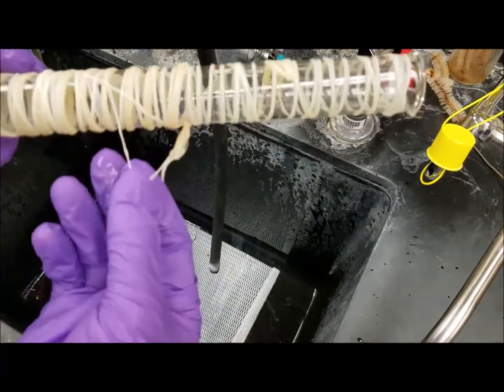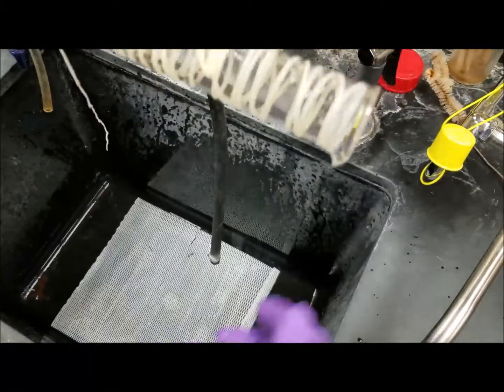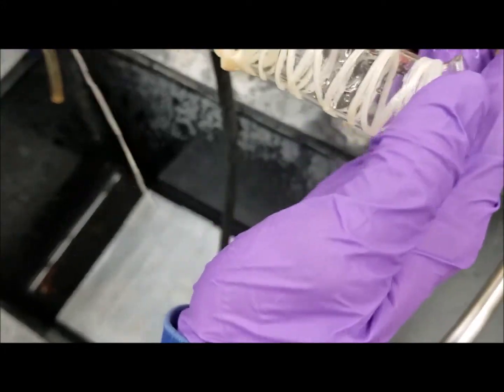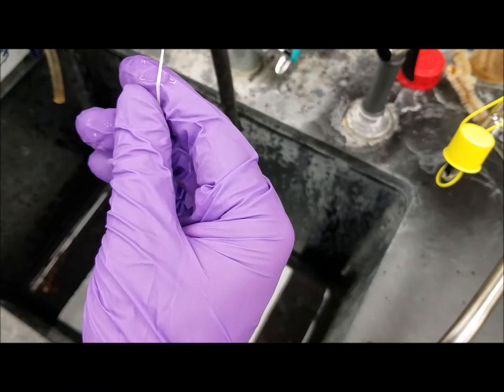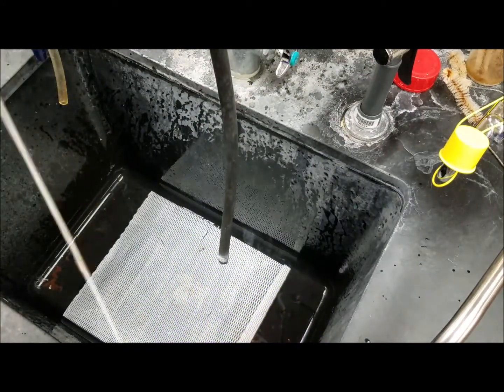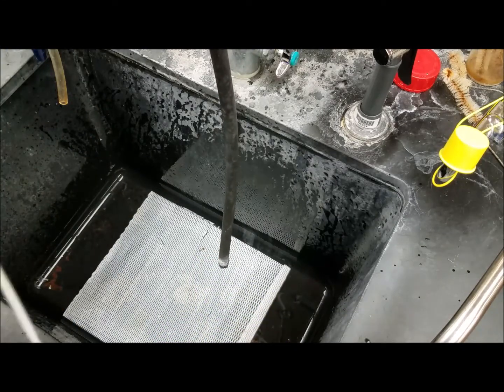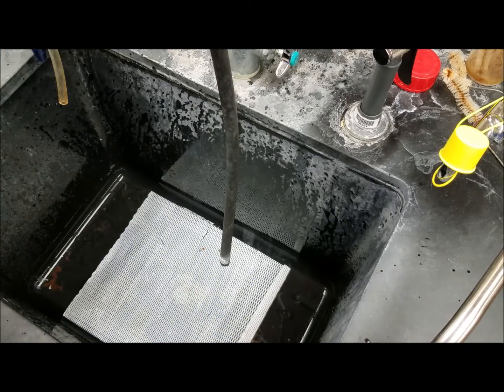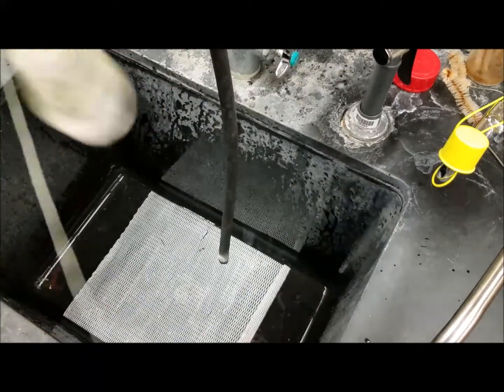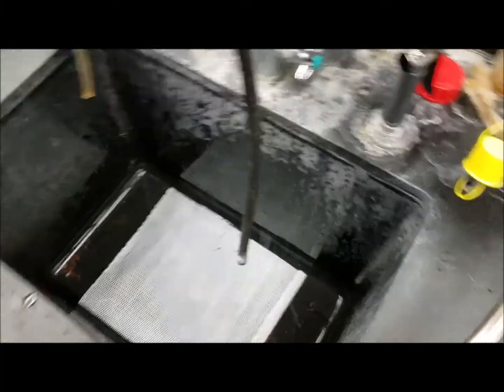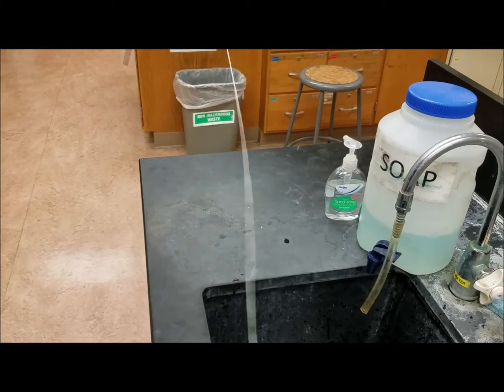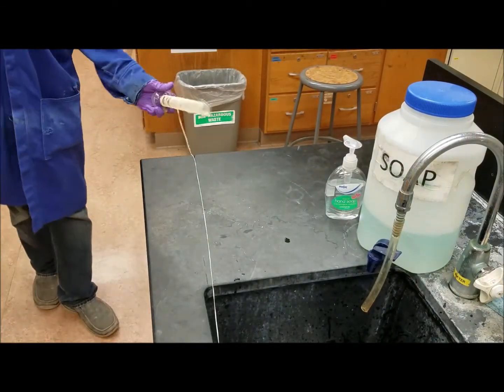Okay, well that, what came off at the end is very fragile. Okay, so we're just going to, I don't even know, it says dry it on a paper towel, I don't know how I'm going to put something this long on a paper towel. So we are just going to wrap it around the lab.